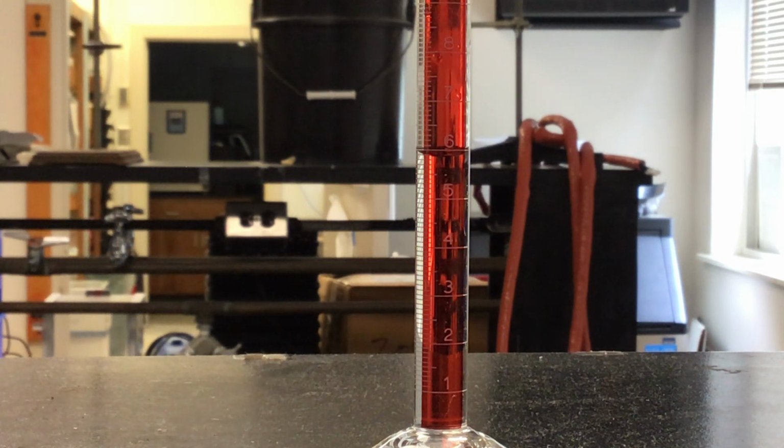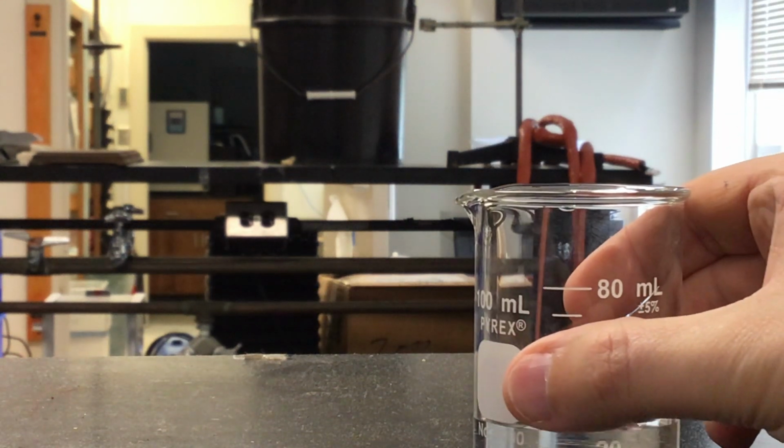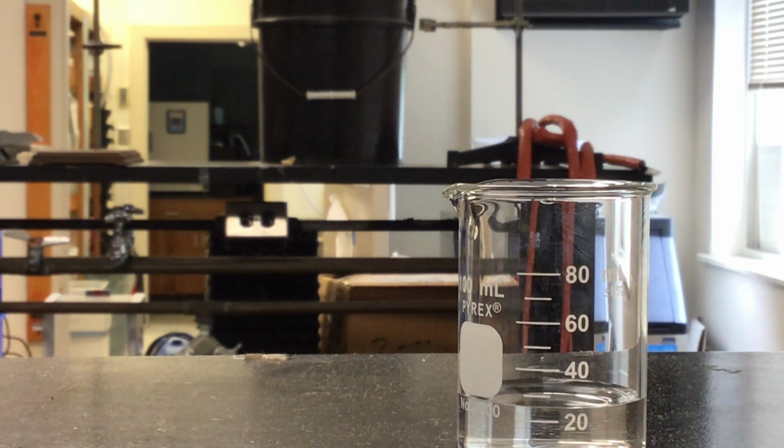By giving the number of decimal places that we give for that measurement, that's giving us an idea of how well we actually know what that measurement is. And that's why we typically use graduated cylinders to make these measurements. They're a lot more accurate, say, than beakers or flasks, which I'll take just a quick peek at in comparison. If we were to put, say, a beaker up here, we'll notice that the tick marks on a beaker are not nearly as prevalent. There's not nearly as many of them. We have it just every 10 milliliters for a tick mark.